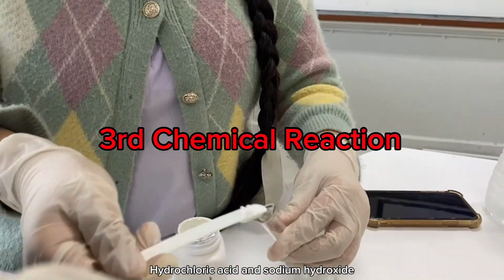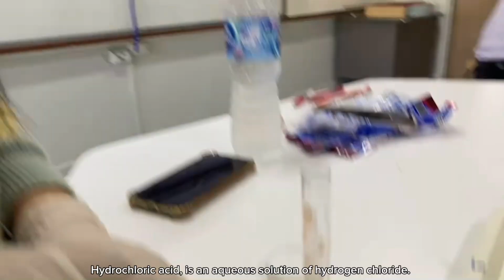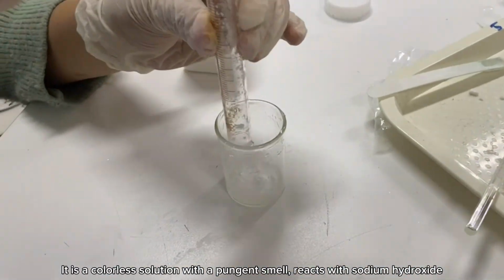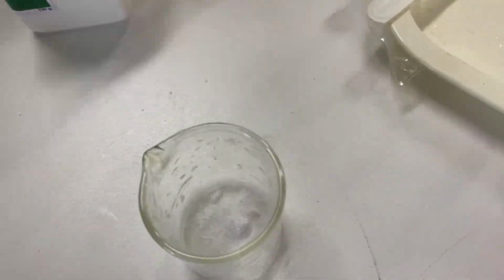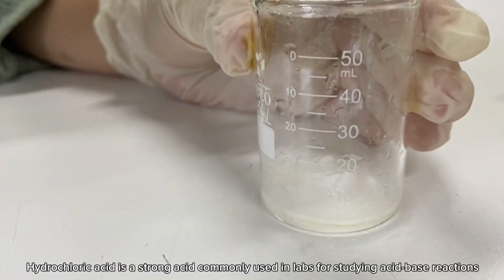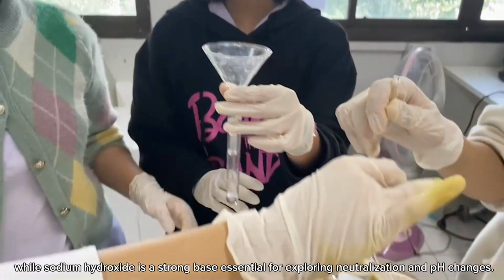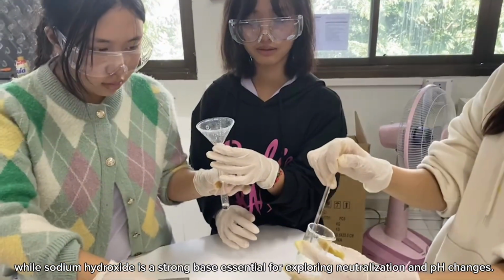The third one is hydrochloric acid and sodium hydroxide. Hydrochloric acid is an aqueous solution of hydrogen chloride. It is a colorless solution with a pungent smell that reacts with sodium hydroxide, which results in the formation of sodium chloride. There will be a slight increase in temperature in this reaction. Hydrochloric acid is a strong acid commonly used in labs for studying acid-base reactions, while sodium hydroxide is a strong base essential for exploring neutralization and pH changes.